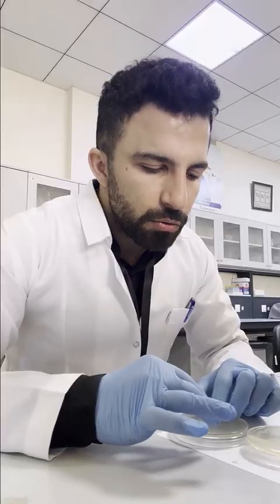The method that we are going to apply today is the disk diffusion method, using a special agar called Mueller-Hinton agar. In this agar, different types of antibiotics are going to be placed with the inoculated tested microorganism, and then we are going to incubate the plate at 37 Celsius for 16 to 18 hours. If an organism is sensitive to an antibiotic, a clear zone will be produced around the disc, and then we are going to interpret the results.